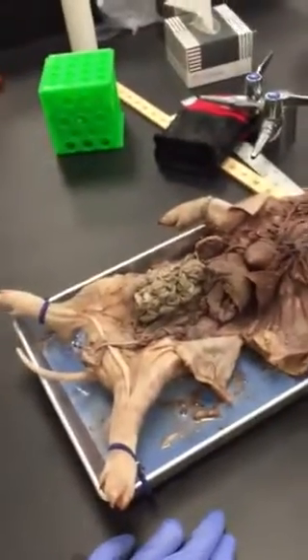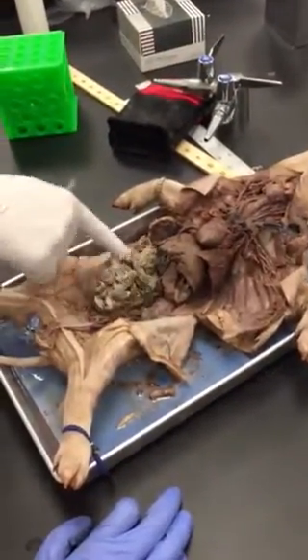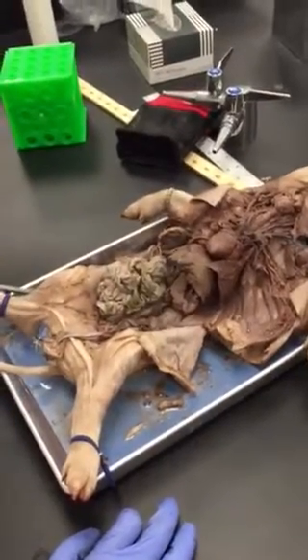Are you guys able to see everything? You're doing your male reproductive on here, and then we're going into depth. Okay. And then the rest of it's next.